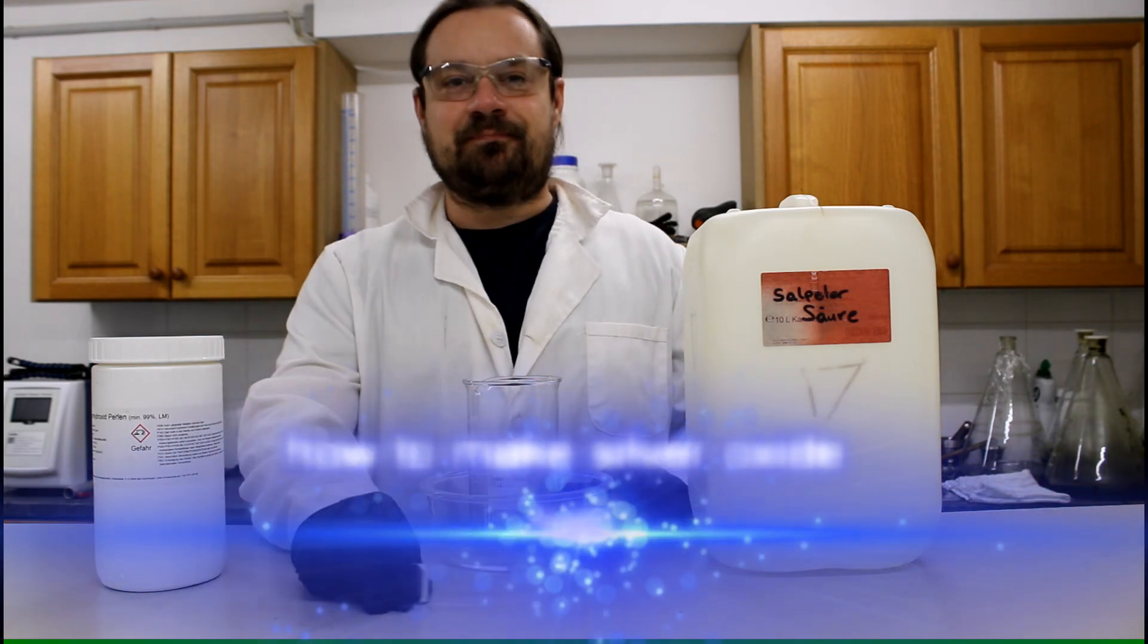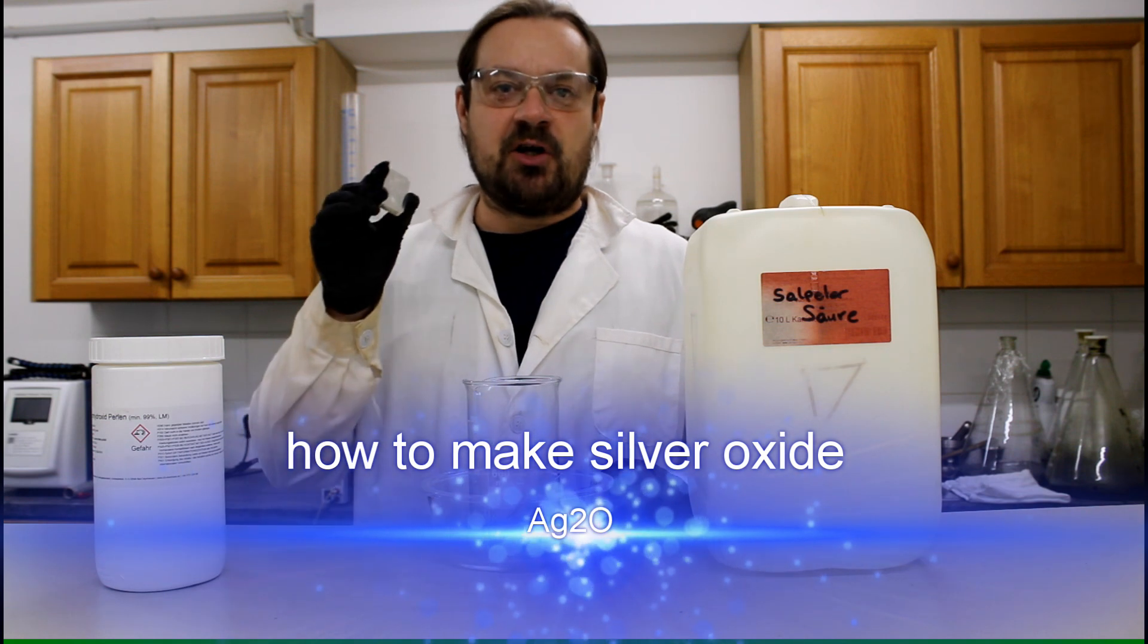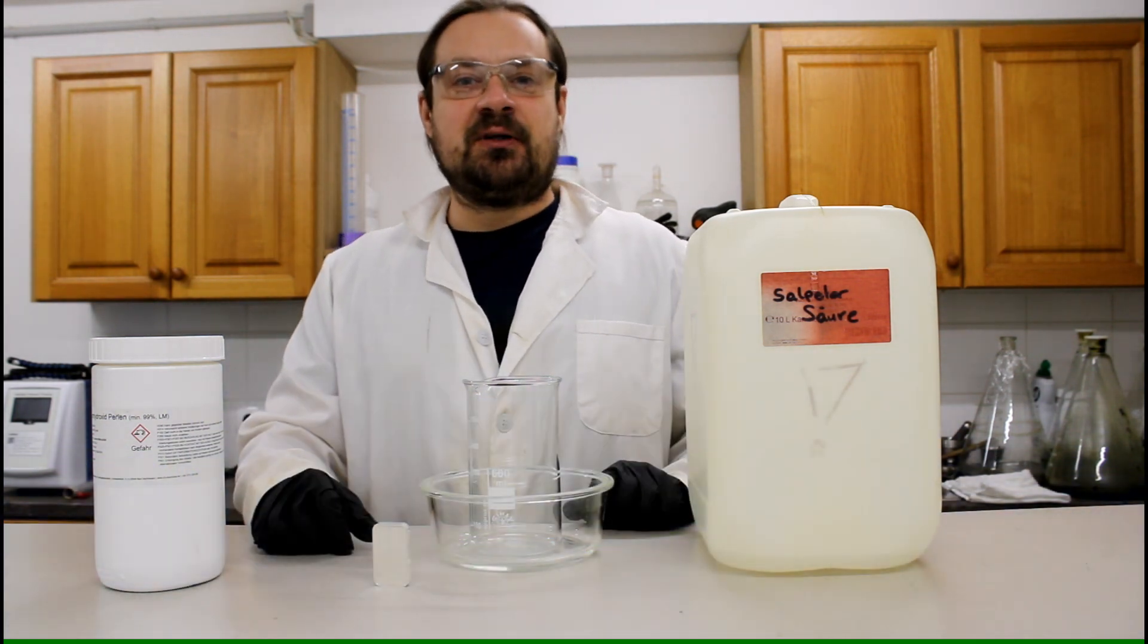Hello everyone! Today I'm going to show you how to produce silver oxide. It's actually fairly simple.